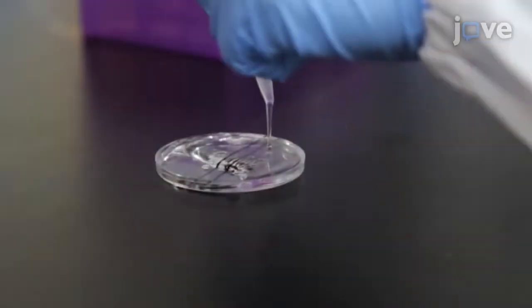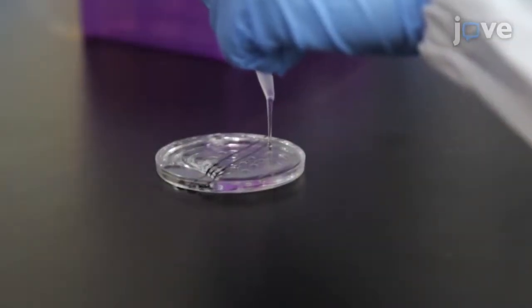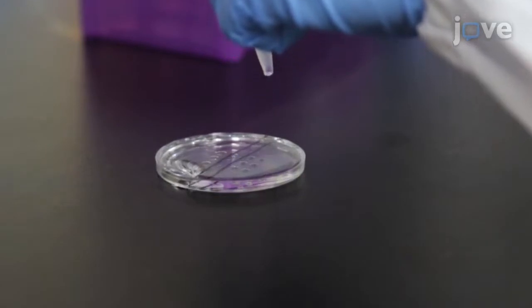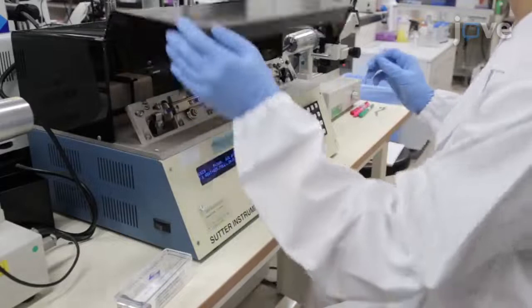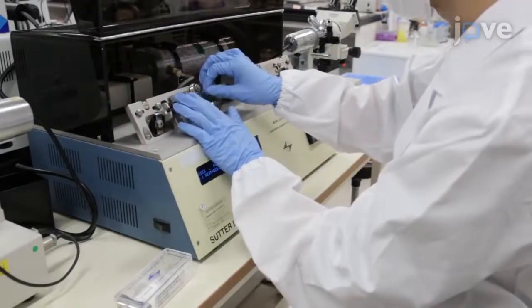Then, use mineral oil to cover the drops. Using a pipette puller, pull borosilicate glass.